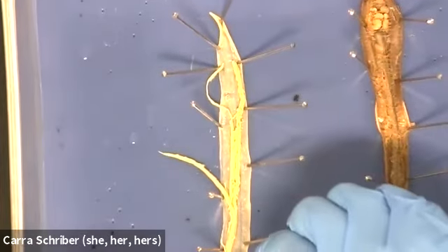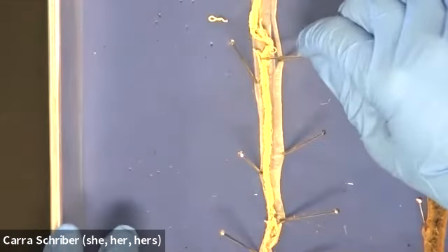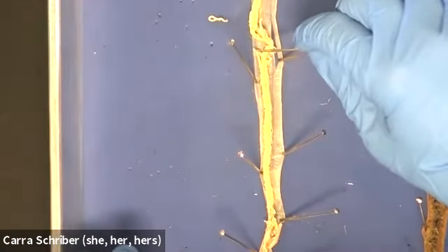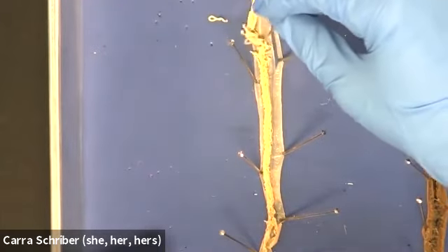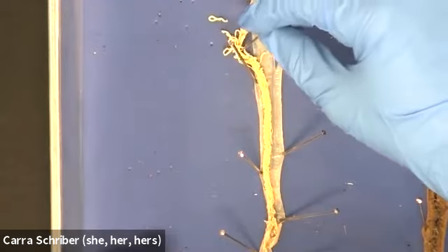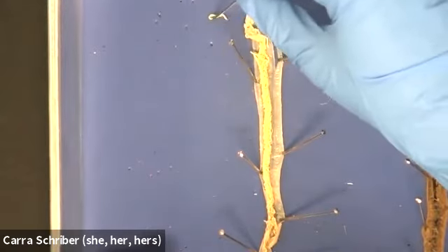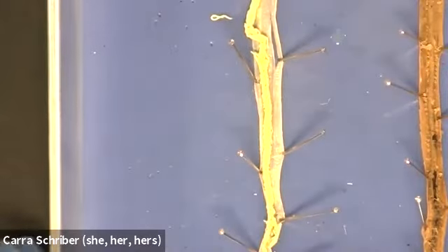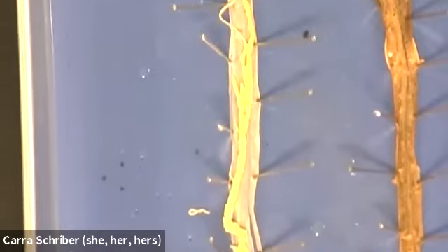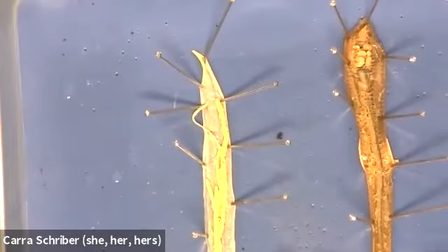Those tubes of the uterus go down to about halfway or 2/3, at which point they turn into these really small squiggly bits, which are the ovaries. And that's pretty much it in terms of the roundworm organ systems. So it's just digestive system and reproductive system, and that's it.